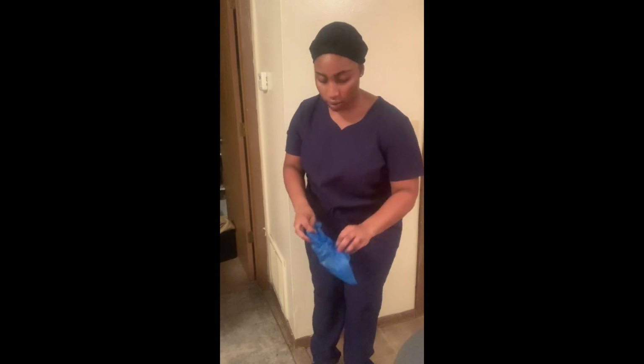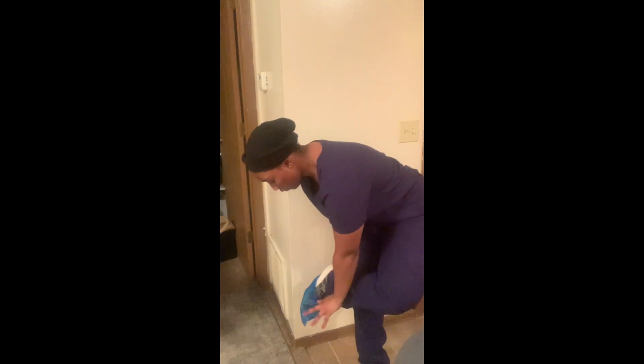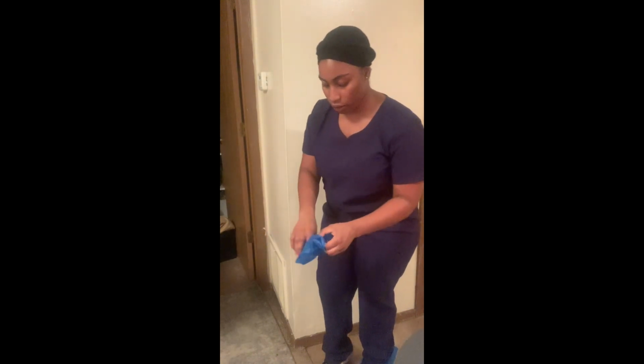Okay, so next is putting on all of our garbing stuff to perform our prescription. So first I'm going to put our shoe covers on. Put that over my shoes. This over my shoes.